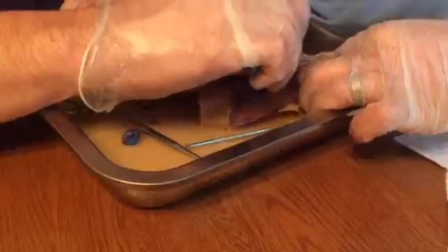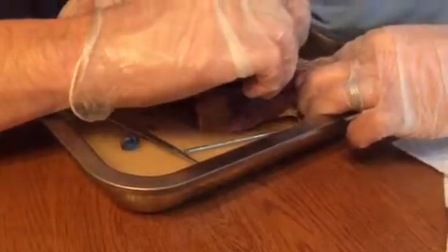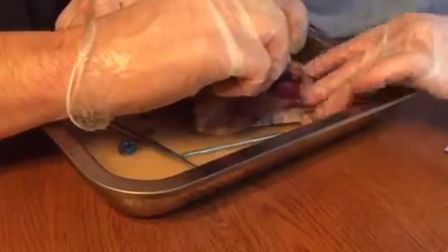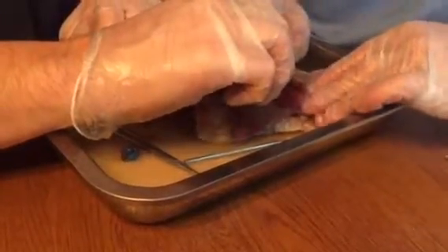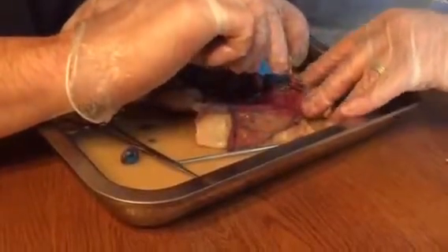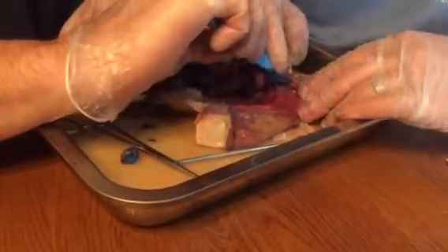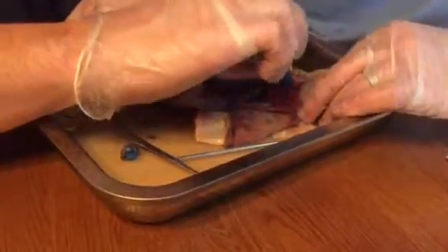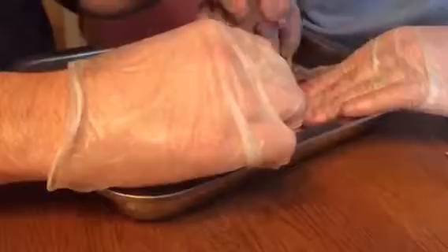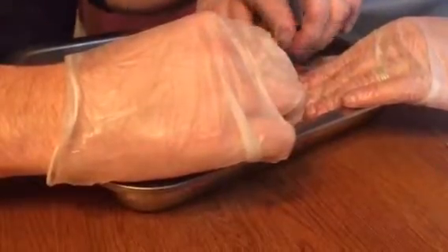New dye guy. But there's your lungs. They got your lungs right next to each other. Here's your aortic arch, coming across, and it dives down into the descending aorta. It gives branches to the carotids and the subclavians. Pull the lungs out of there. You can see behind them.